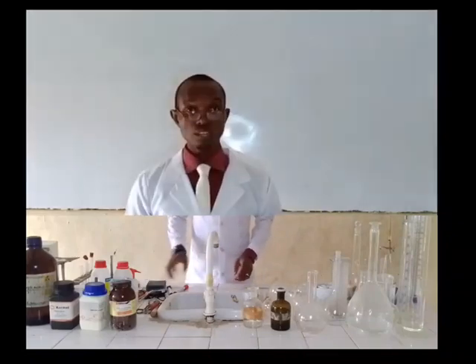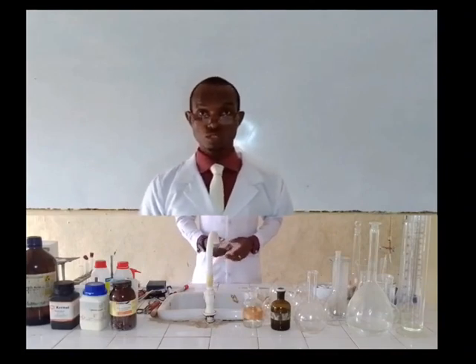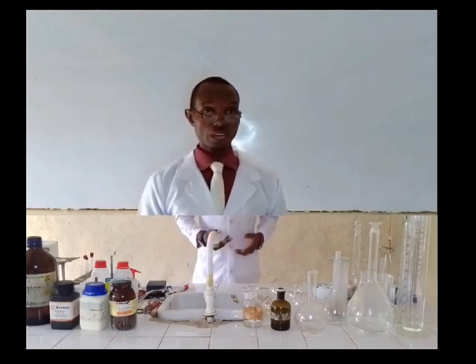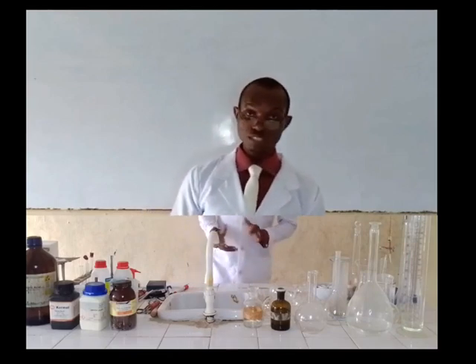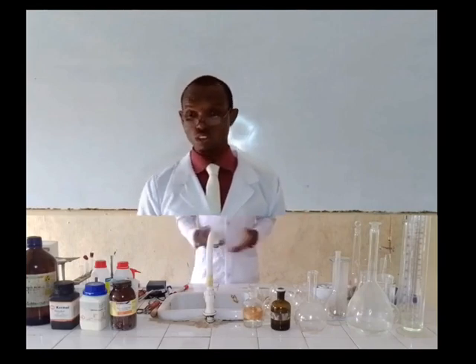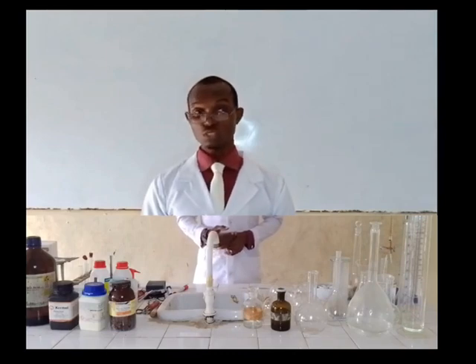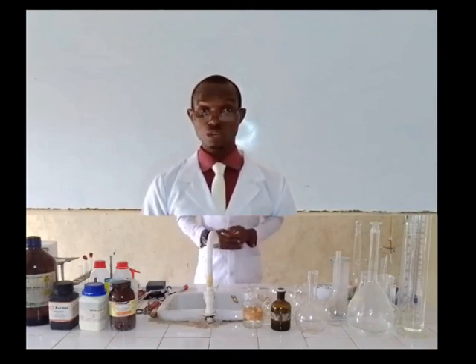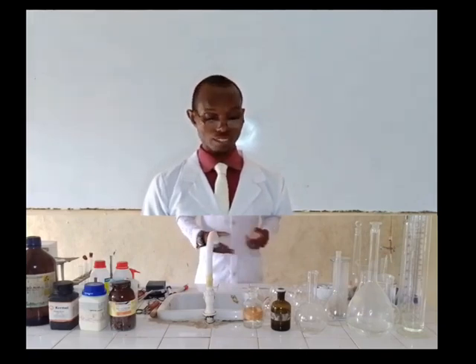Good day everybody. Today we want to look at familiarization of laboratory instruments. We want to make a quick brief introduction to laboratory apparatus, starting with our glassware. When you get into the lab, it is very important that you know what your glassware and all laboratory apparatus are, how they are, and what they are used for. You need to know the condition of all of the apparatus, as that can help you carry out effortless practicals.